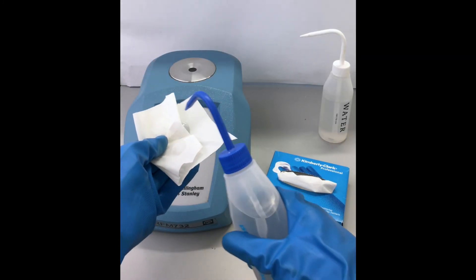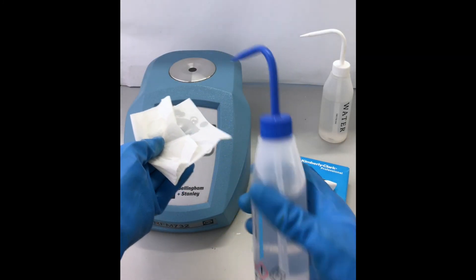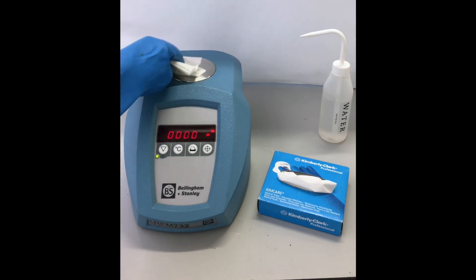Re-clean the measuring prism and the prism plate with isopropanol and tissues ready for the next user.